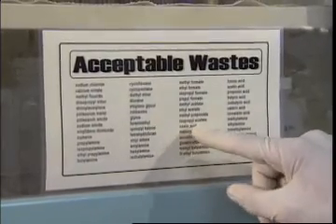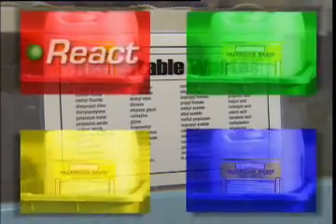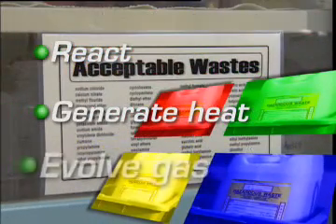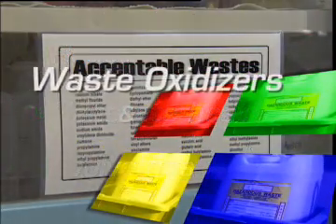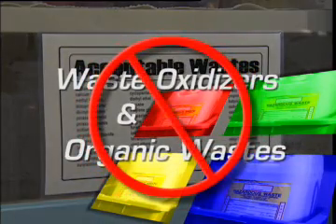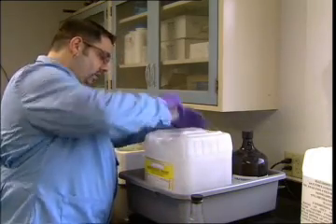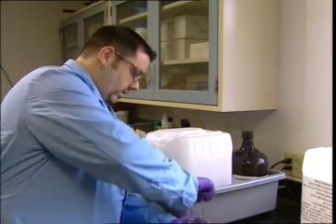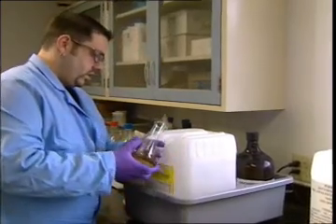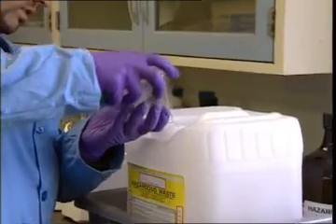All the wastes in a single container must be compatible. That is, they should not react, generate heat, or evolve gas. For example, you would not place waste oxidizers in a container with any organic wastes. These two wastes could react violently. Satellite areas should not interfere with normal lab operations. Emptying wastes into satellite containers should be easy and convenient. Keep the area clean and free of obstructions to prevent unnecessary reaching or contortions.